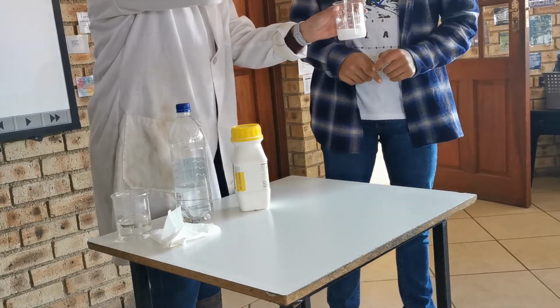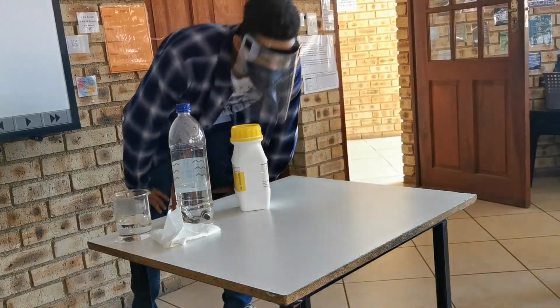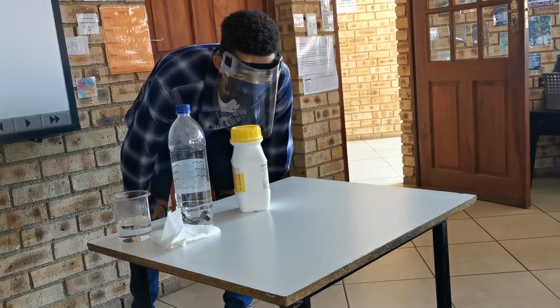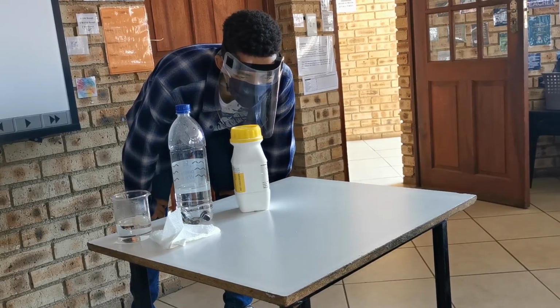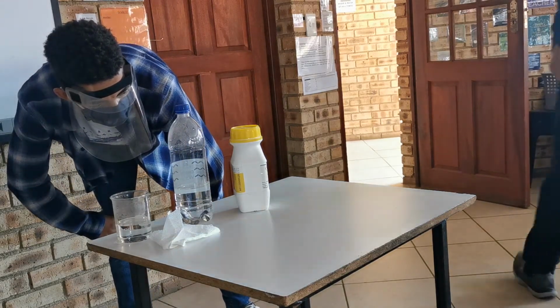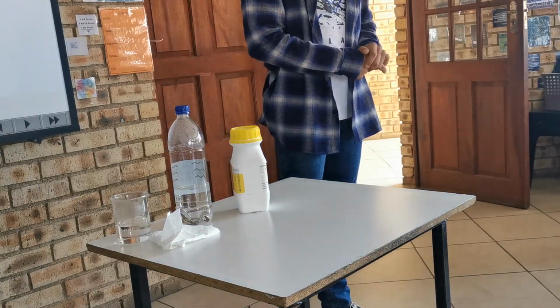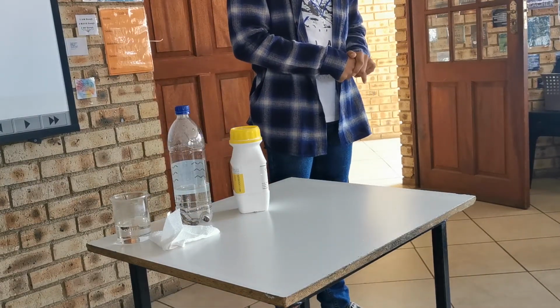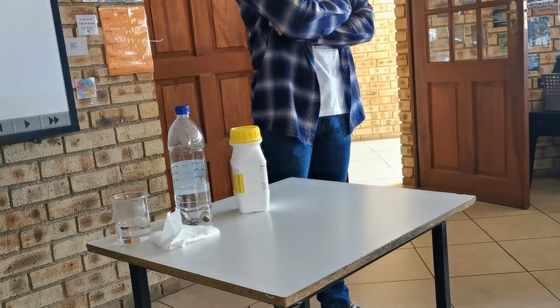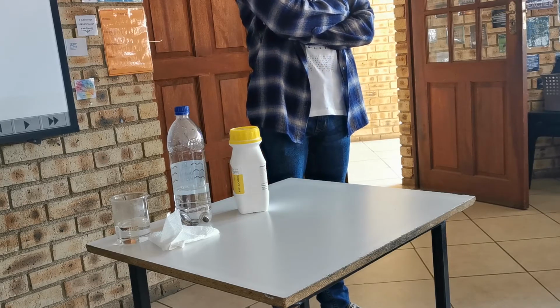Can everybody see the red? I'm just going to walk around so that you can see the red. It started at 10, and the temperature is decreasing as we speak. It's nearly on zero, in fact. I'm not expecting it to go very close to zero, but that's pretty phenomenal. I've got a nearly 10 degree difference in temperature just by adding some salt. You see it?